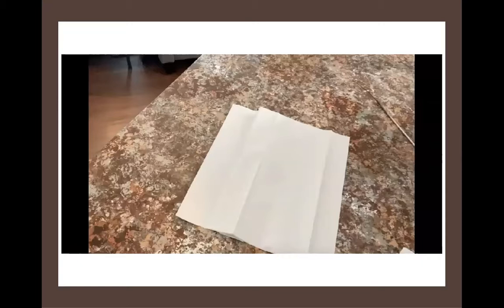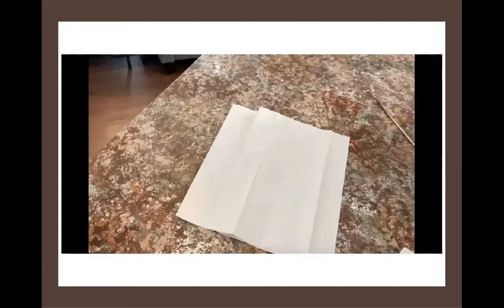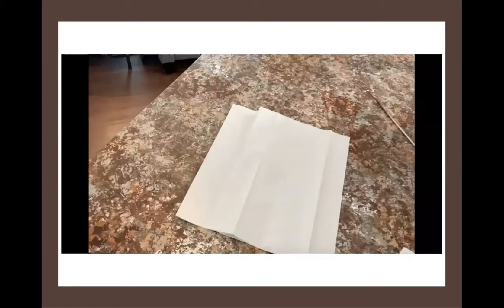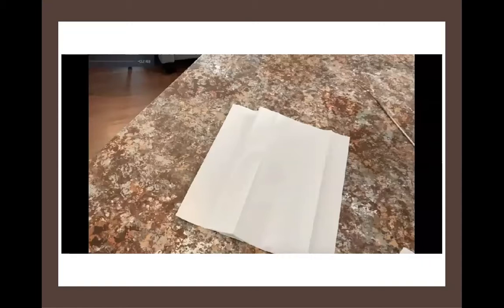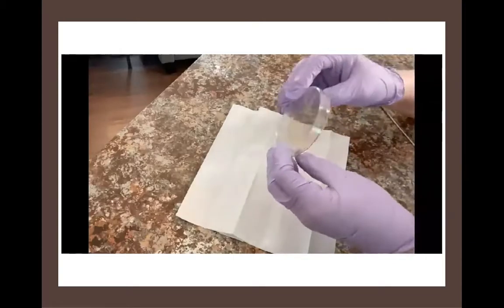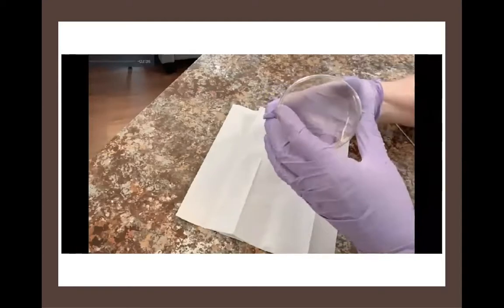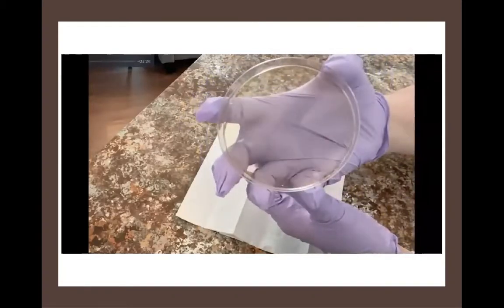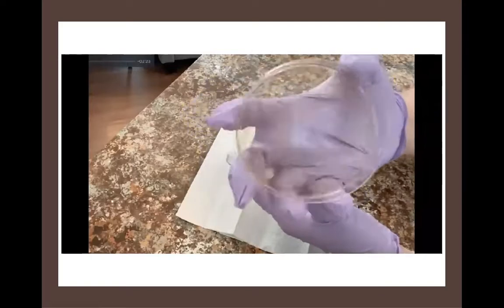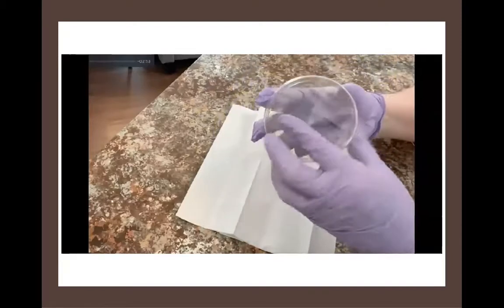Now let's look at a transfer from a broth tube to an agar plate. We use plastic single-use petri dishes in the microbiology lab and pour agar into those dishes, allowing it to solidify to give us a solid media. We refer to those as agar dishes or agar plates. The agar has nutrients added so that bacteria can grow. This is an agar plate — it has nutrient agar on it. You can just see a thin, beige film on the bottom. It feels a lot like gelatin and it's easy to push your loop into it, so you have to be careful when handling it.